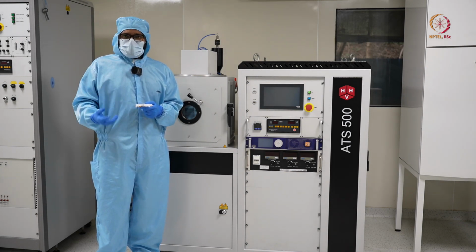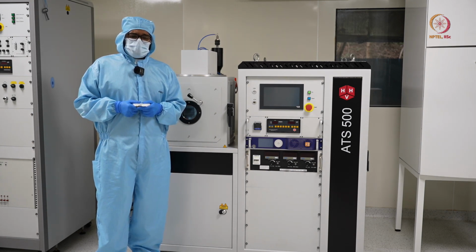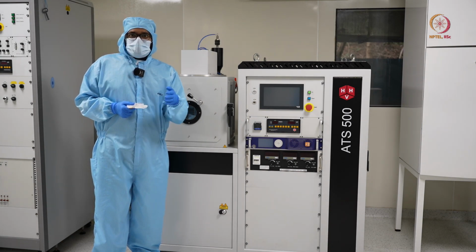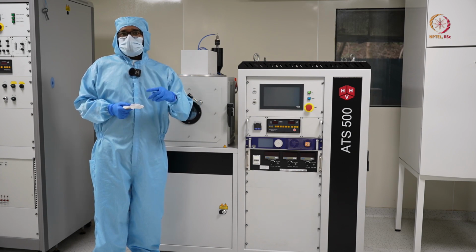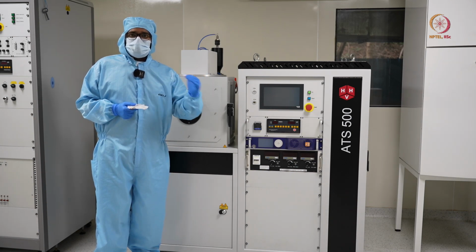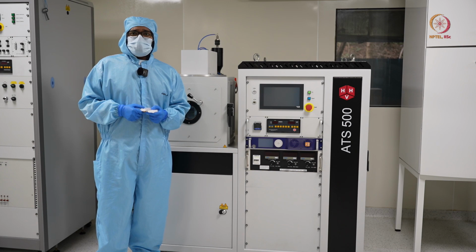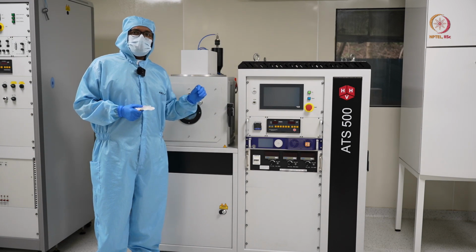When you are melting it off, like using E-beam or resistive heating, it might happen that component A has a different melting point than component B. So although you have a source which has a 30-70 composition, the rate of melting will vary depending on the melting point, and the thin film that you have on your sample might not have a 30-70 composition. It might have something like 10-90 or 50-50. You don't know. So in that case also we will move to sputtering.